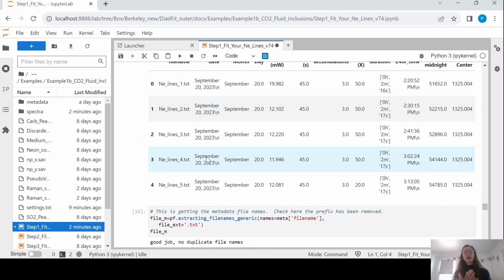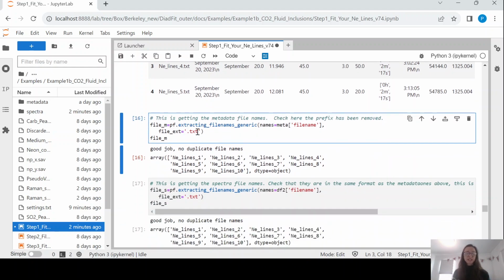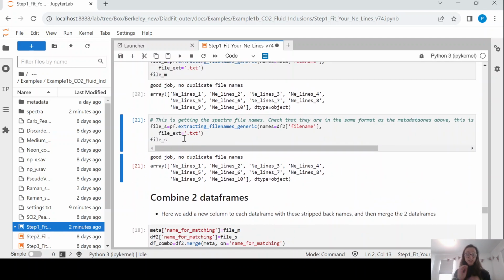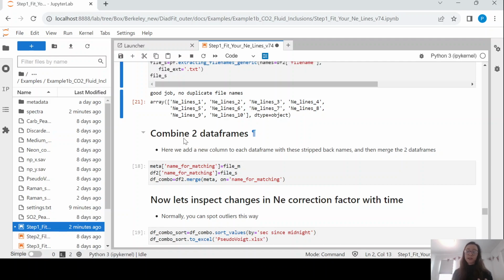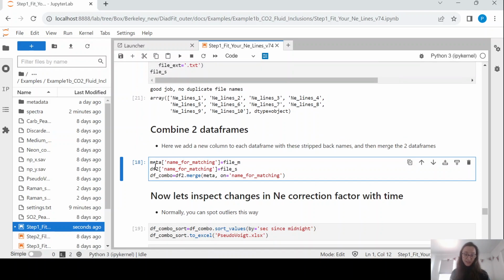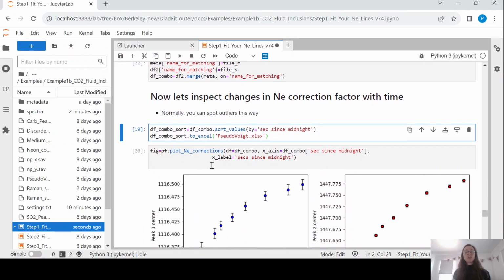So we just want to make sure the file names are the same, and this is when having a prefix can mess you up. So we're just going to check that the file names for the metadata look right, and that the file names for the spectra look the same. If they don't, you're not going to be able to automatically merge them. Then we're making a new column called name for matching on the metadata data frame and the data frame for the spectra fits. We then combine them together, and we have a combined data frame which has our peak parameters and, importantly, our timestamp. Okay, so now we're just going to sort them by the time after midnight.